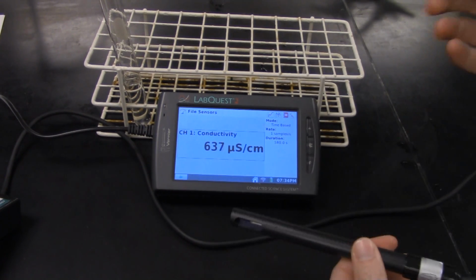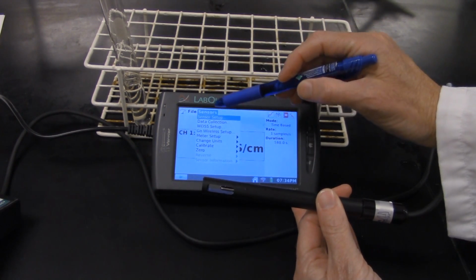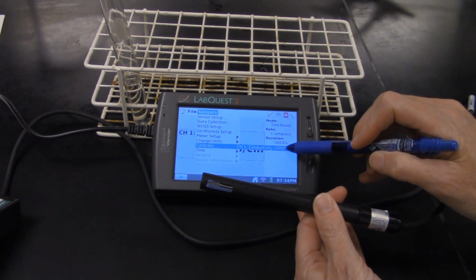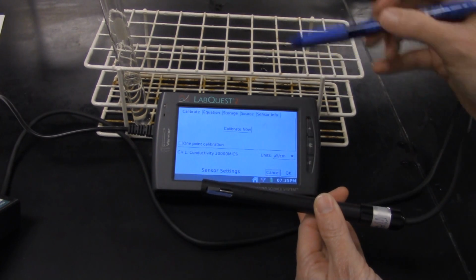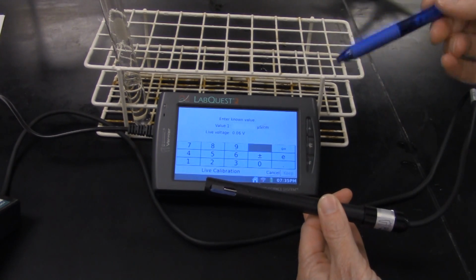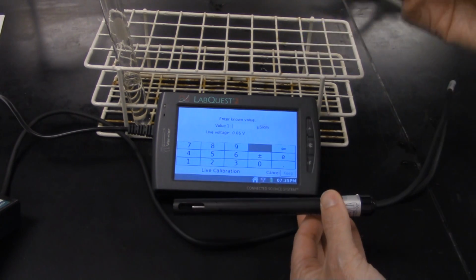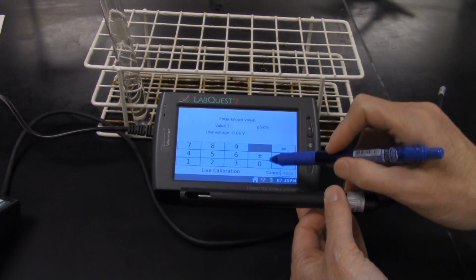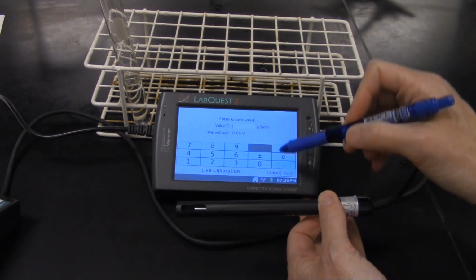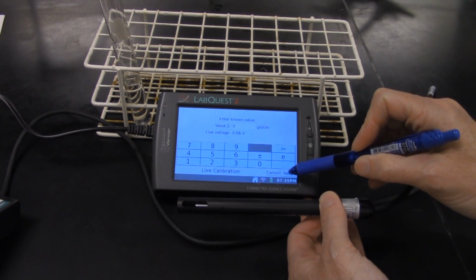There are instructions in the lab manual for it, but to show you how this works, you go to the Sensors menu and select Calibrate, and it should be on the 0 to 20,000 range. We're doing a 2-point calibration where we say that when the probe is in air, it should have 0 conductivity, which makes sense. Notice the voltage reading here, 0.06. You don't have to write that down, but we're going to enter a 0 for our conductivity and click Keep.